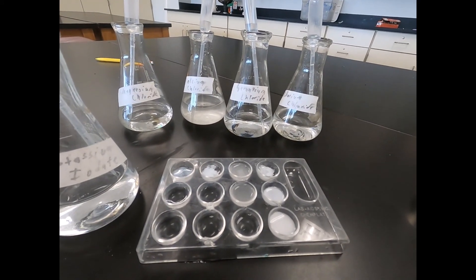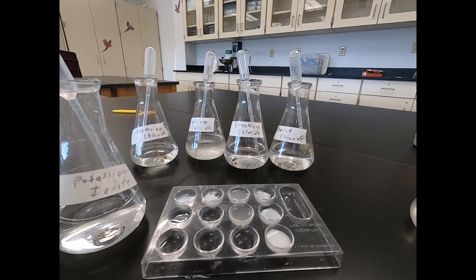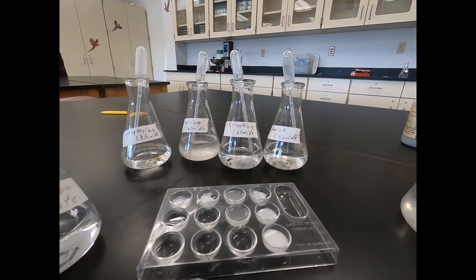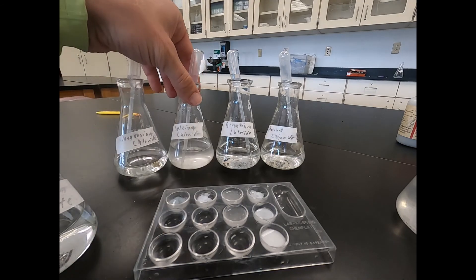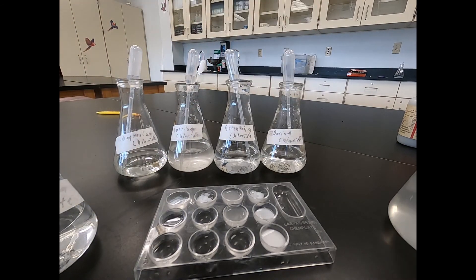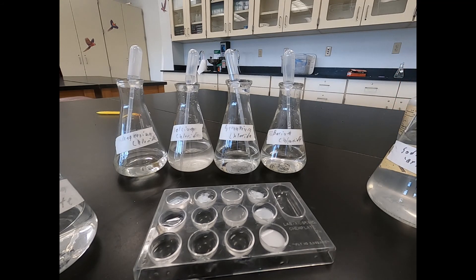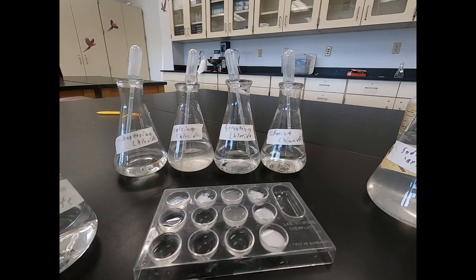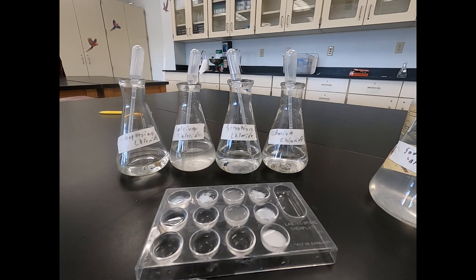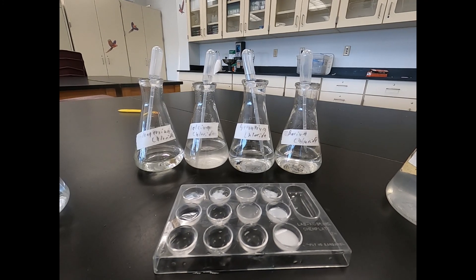And you can see we just have one precipitate form in that case. So we're looking for trends on our periodic table. In this case we were reacting magnesium chloride, calcium chloride, strontium chloride, and barium chloride with sodium carbonate in the first row, sodium sulfate in our second row, and potassium iodate in our final row. Thank you. Hope you enjoy it and get some valuable information. Have a great day.